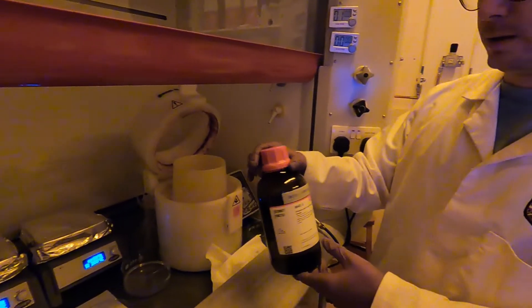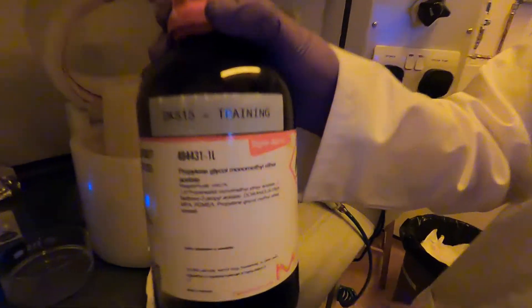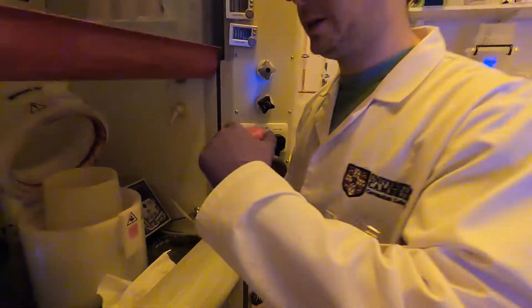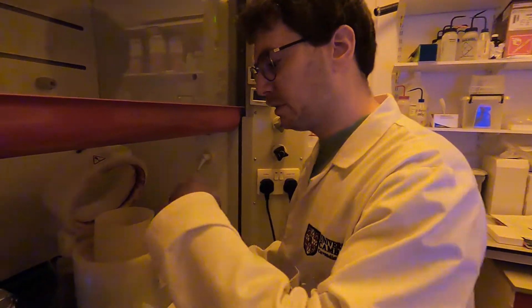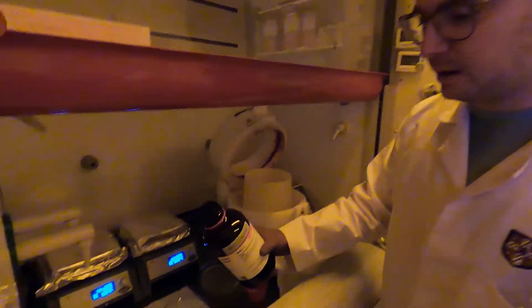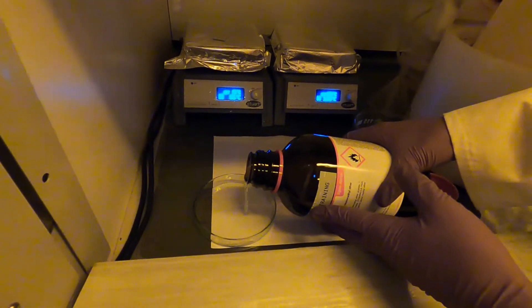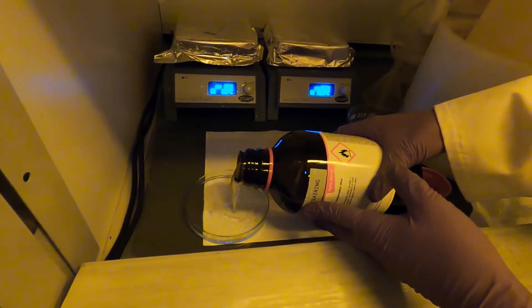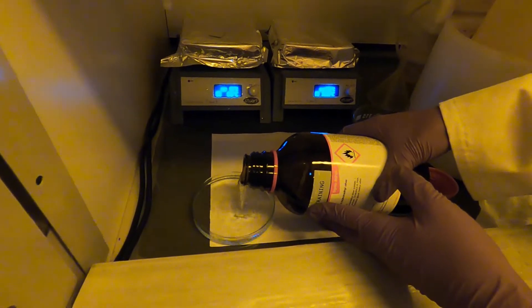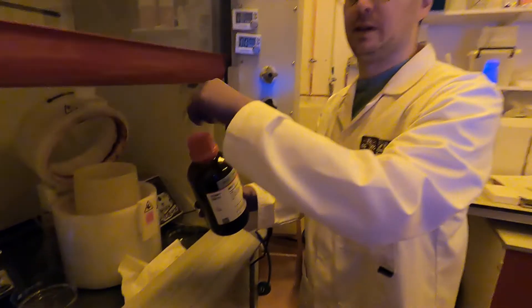In the meantime, we'll prepare the chemicals for development. We're going to need two chemicals. One is the so-called PGMEA. We're going to fill a petri dish of the appropriate size, roughly halfway up with PGMEA. You want to put enough PGMEA to comfortably cover the whole sample with the liquid.